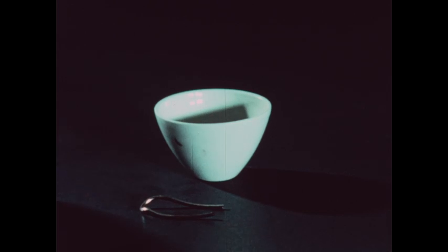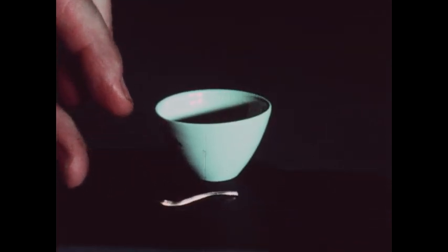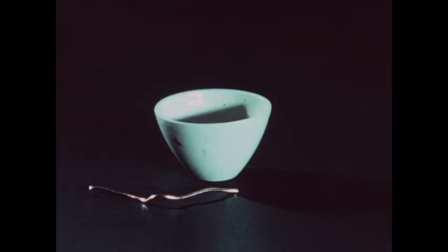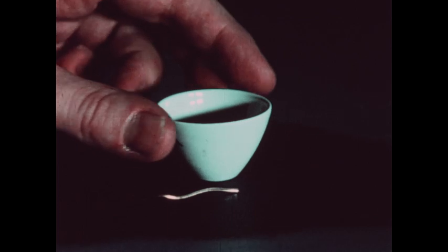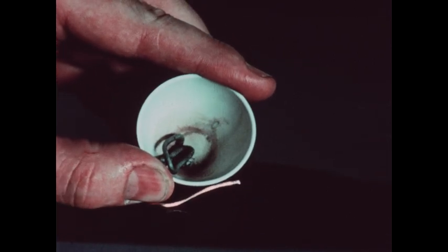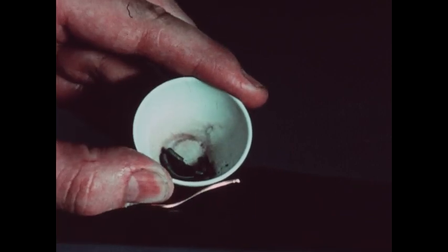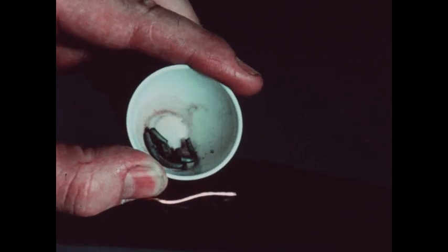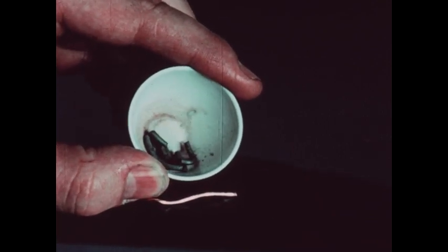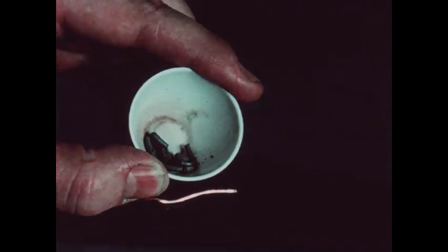In this film, we've seen how we started with an accurately weighed piece of copper metal with its normal flexible properties, placed it in a crucible, added sulfur, heated it, and obtained cuprous sulfide — an entirely different set of properties. We then proceeded to a determination of the formula of cuprous sulfide, Cu₂S.